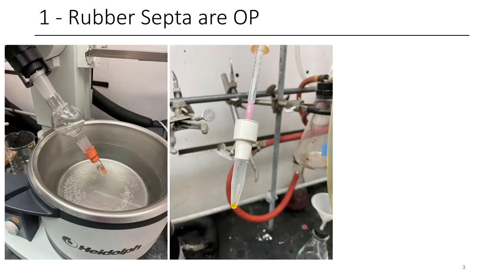And then recentrifuge it down and then high vac it again. And so you can see here that we have a one mL syringe with the end cut off. This can just slip into some Tygon tubing and then you can set it up to a Schlenk manifold.